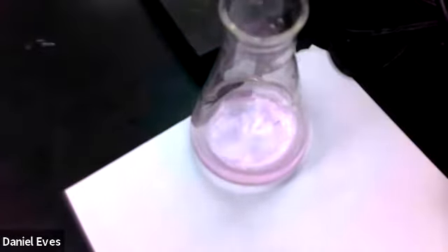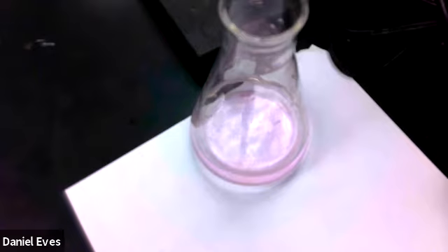So we now should be able to calculate the amount of sodium hydroxide there is based on these two samples. And they were both supposed to be the same mass. So whatever you calculated out for the mass of the potassium hydrogen phthalate, I measured that out the same for both and put them inside of the beaker. So they should have had the same amount of KHP. And so they had different volumes added of the sodium hydroxide.